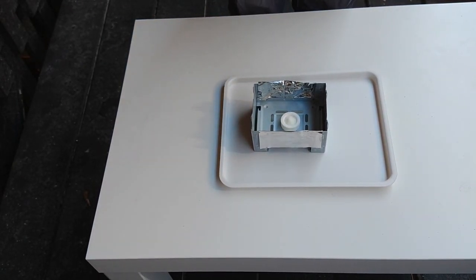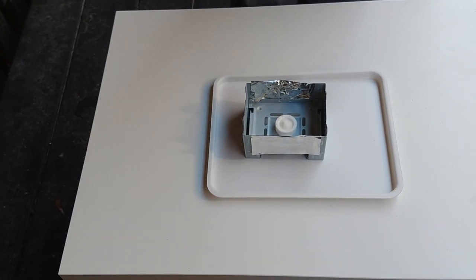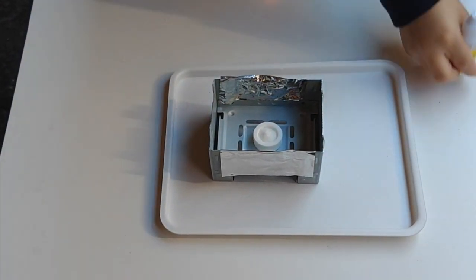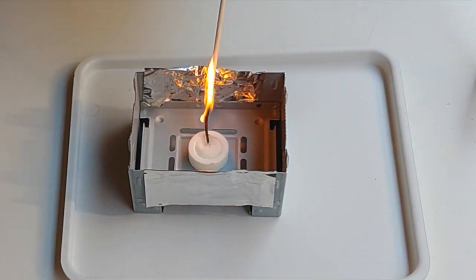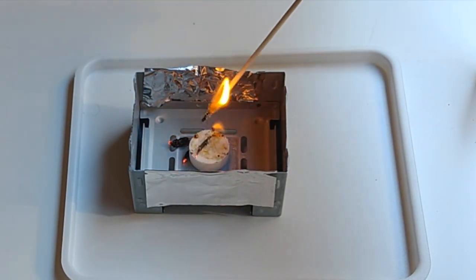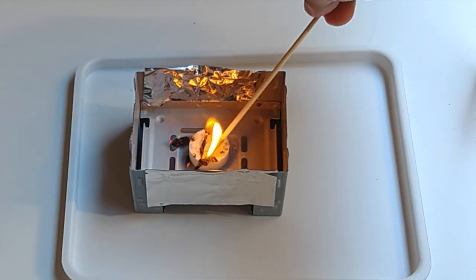I'm going to get a flame. Let's see. Just to prove that it's real flame, right? Woo, on fire. Okay, so take that end. Now stand to the side, and you touch it to the flame. Is it working? Not yet. I'm trying to get the fuel to ignite.